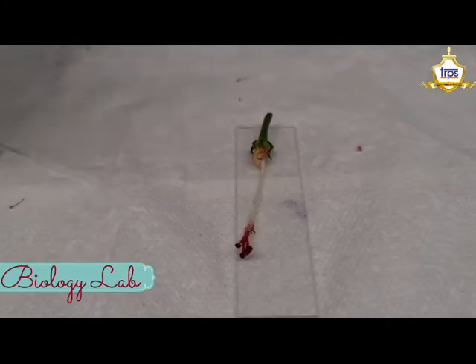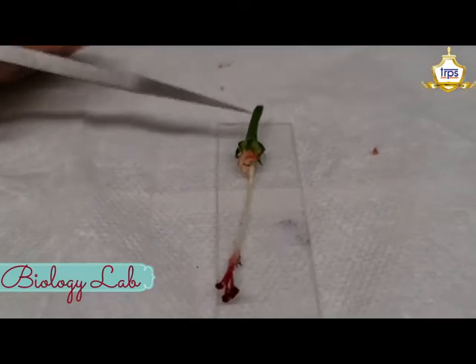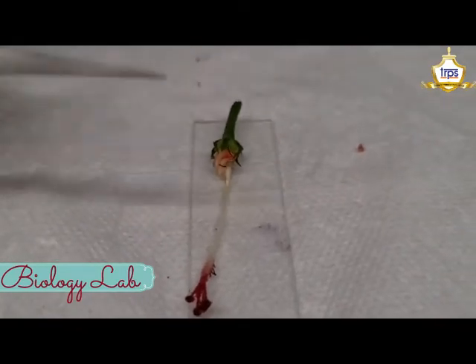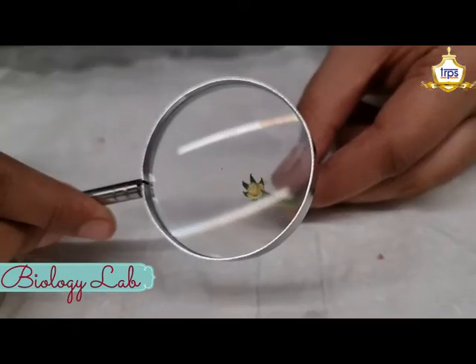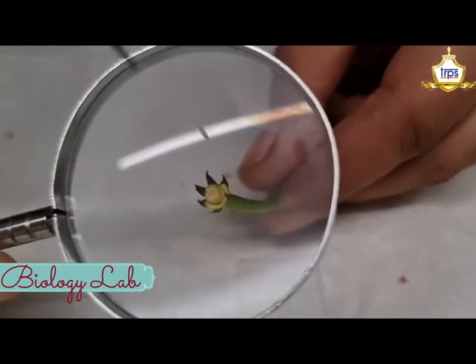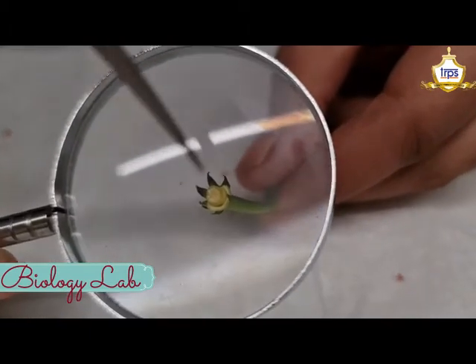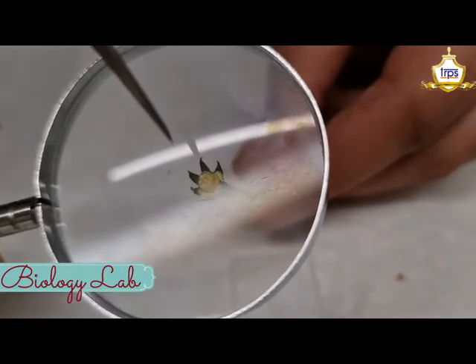Now let us take a look at the cross-section of this ovary to find where the ovules are. After dissecting the ovary, I can see the ovules over here. So students, that was all about the different parts of the hibiscus flower.